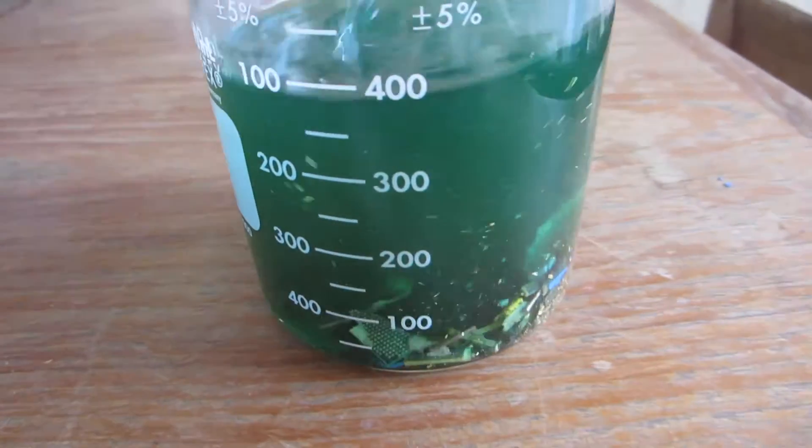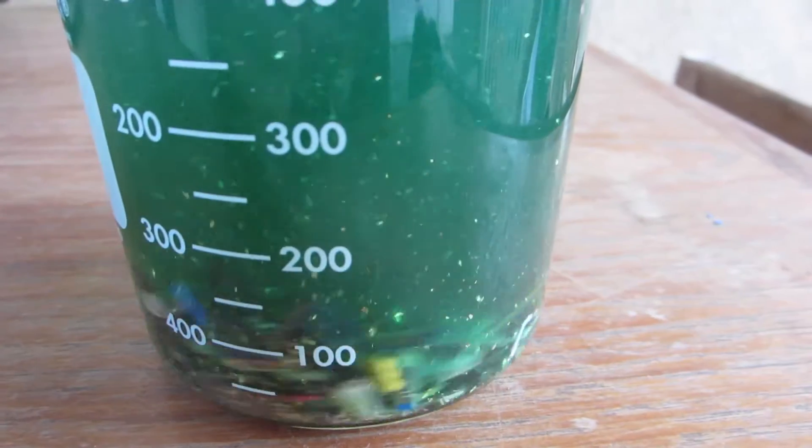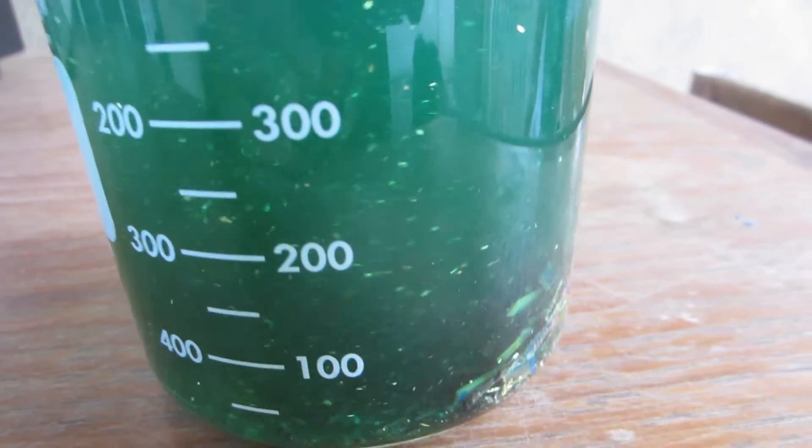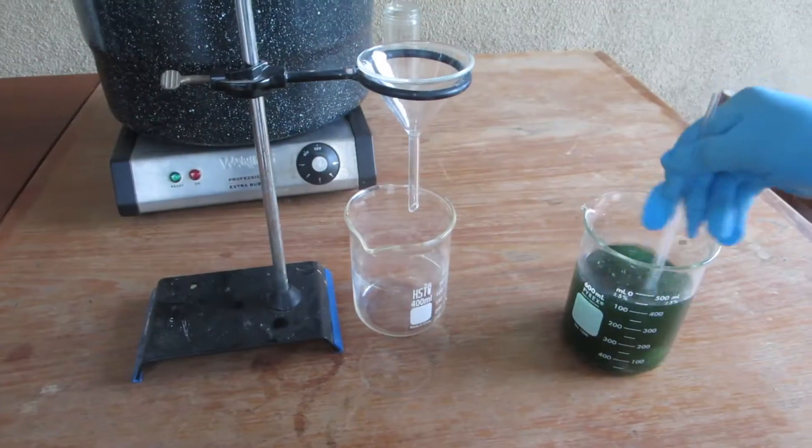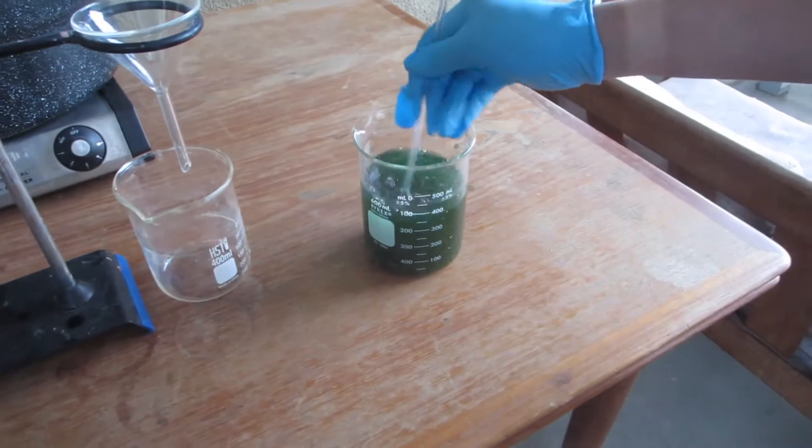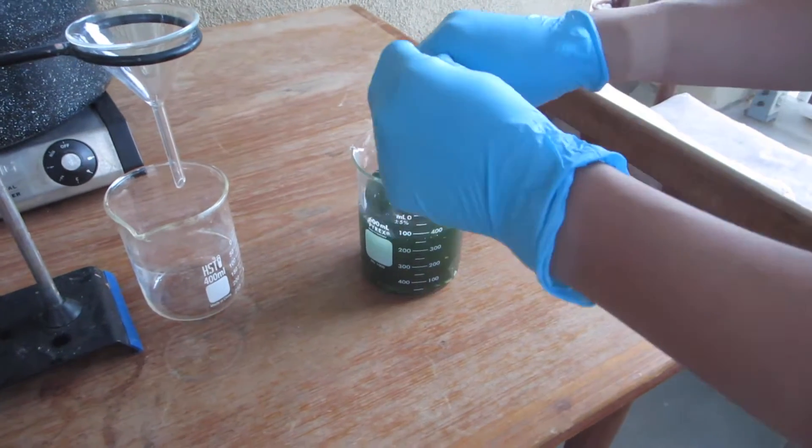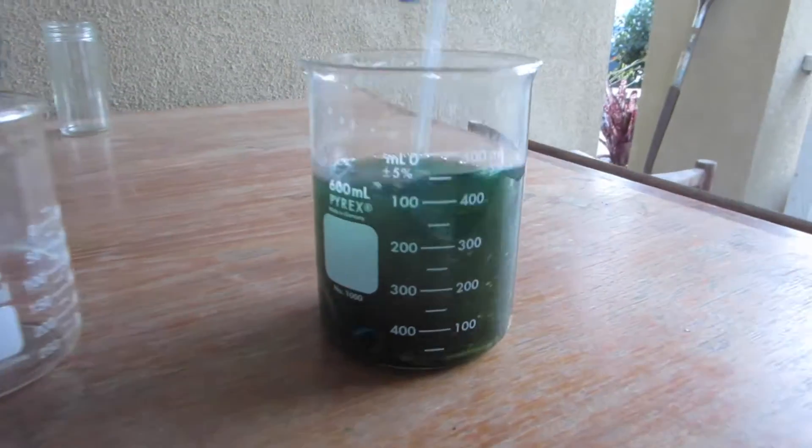Most of the gold foil pieces are floating around. After stirring, you can see the gold flakes come up. I'm going to filter them out into another beaker.